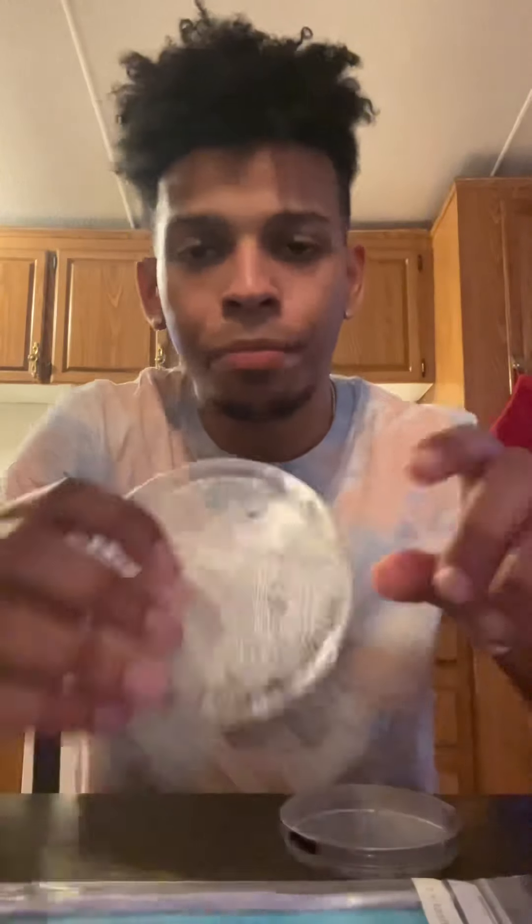It's right here. Before I started this video, I washed my hands, and this is a dedicated set of clothes that I use for doing my experiments.